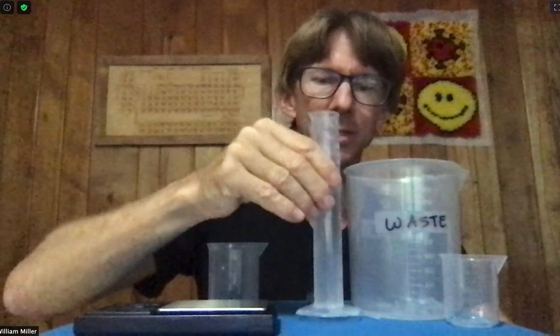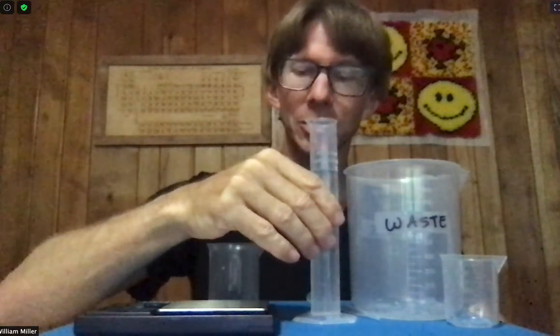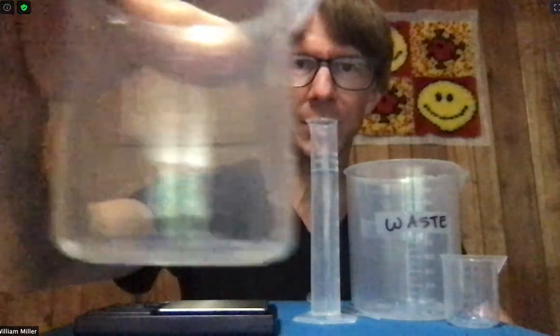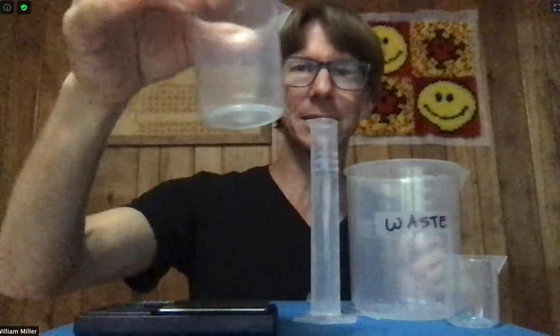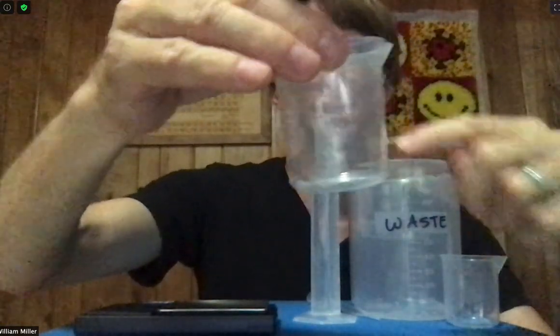I've got my 50 milliliters of solution of a known concentration from before. I need to transfer it to my 100 milliliter beaker, but my 100 milliliter beaker has droplets of water on it. If it's clean and dry, you can pour your 50 milliliters straight in, but since it's not, I need to condition this because this is something different than my solution.